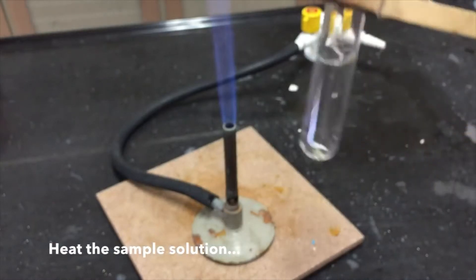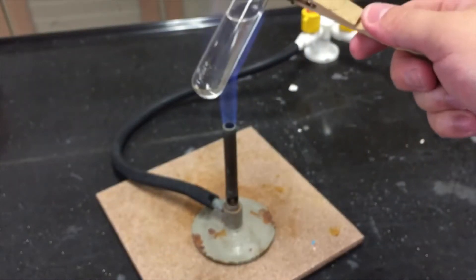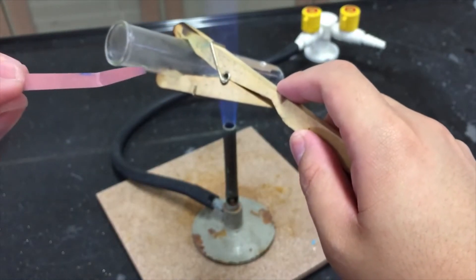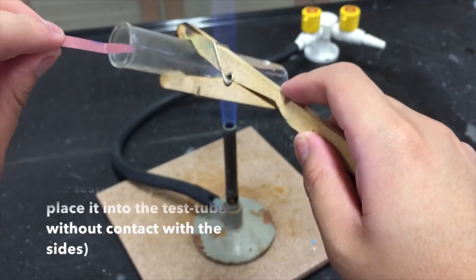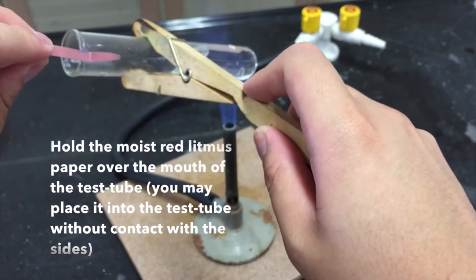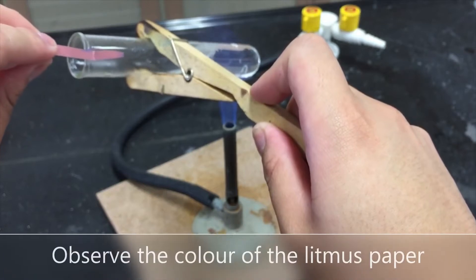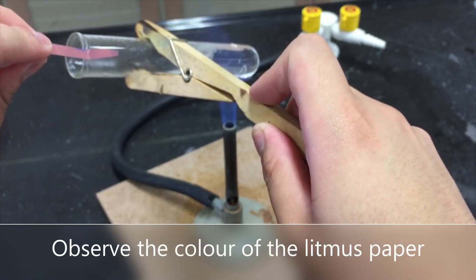Some sodium hydroxide was added to the solid and then it was heated using a Bunsen burner. Afterwards, a gas evolved and this gas was tested using red litmus paper. Please record your observations.